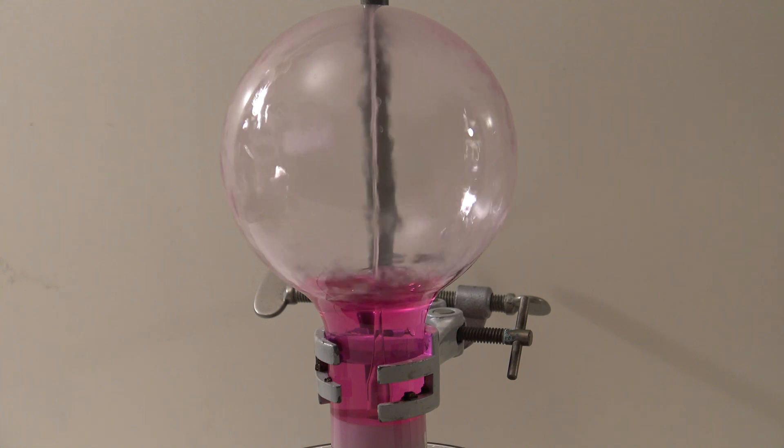This experiment only depends on the solubility of the gas so as an alternative hydrogen chloride can be used.